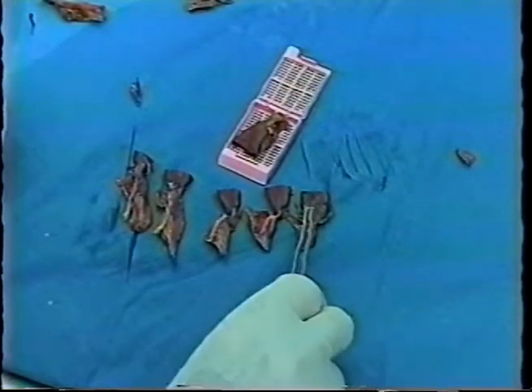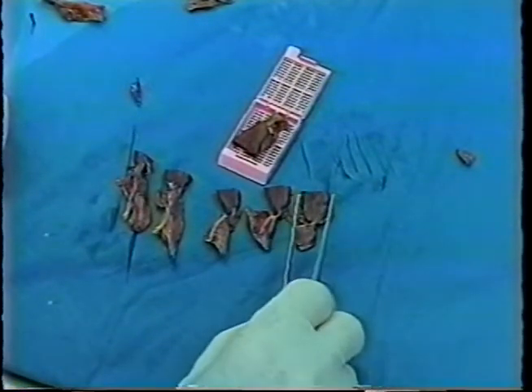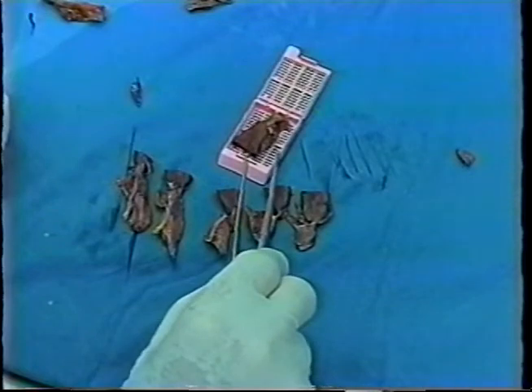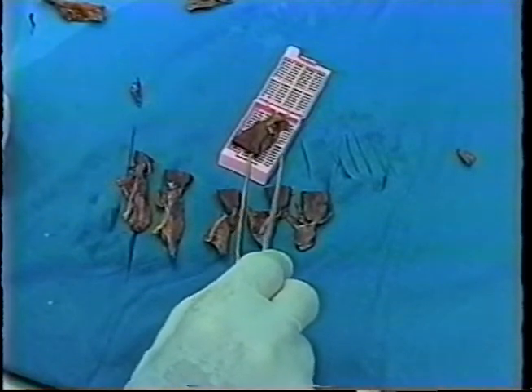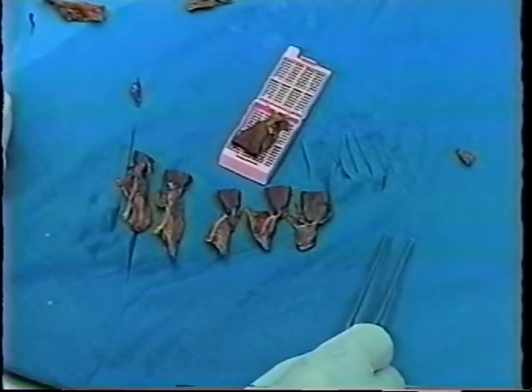A pilot section from each of these is cut for the pathologist to determine which pieces will contain the AV node, and His bundle, and proximal right bundle branch, and then again levels through the block as I described with the SA node can be made.